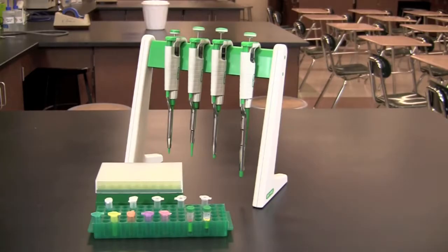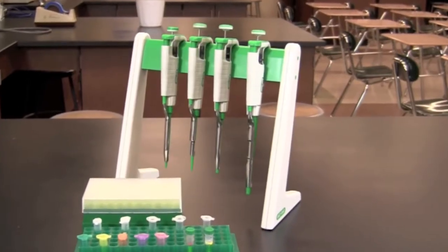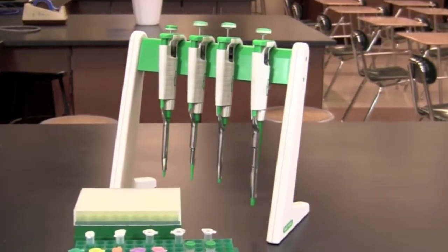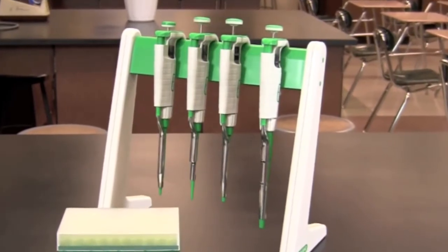In this video you will learn how to use an adjustable micropipette. Micropipettes are one of the most commonly used tools in a molecular biology laboratory. An adjustable micropipette is used to measure and transfer small volumes of liquid.